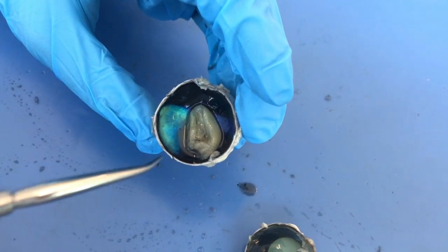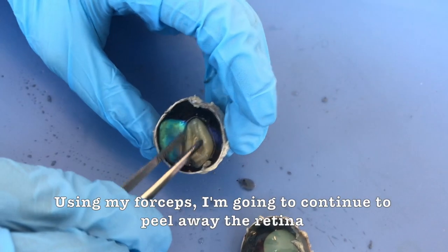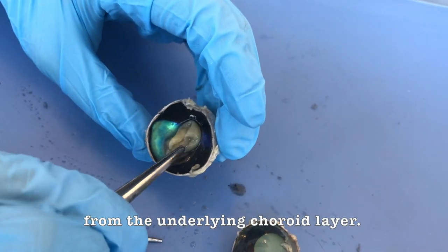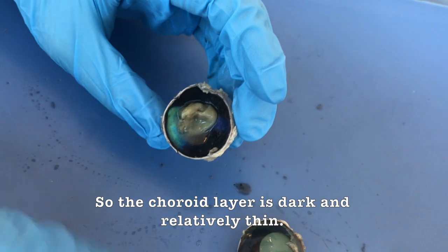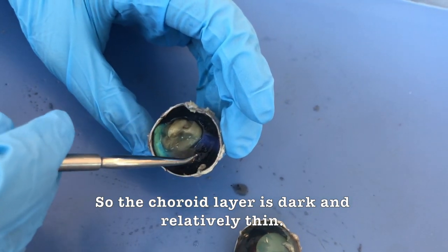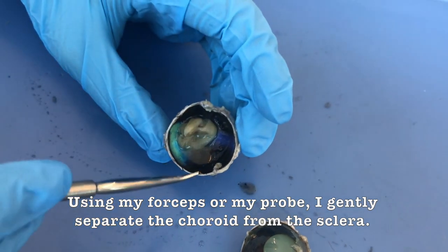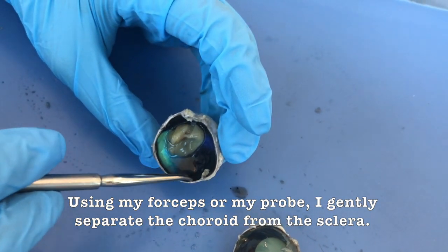nerve to the brain. Using my forceps, I'm going to continue to peel away the retina from the underlying choroid layer. So the choroid layer is dark and relatively thin. Using my forceps or my probe, I gently separate the choroid from the sclera.